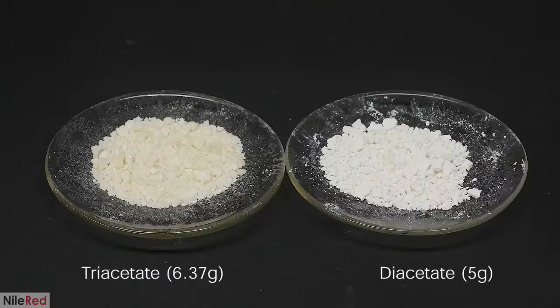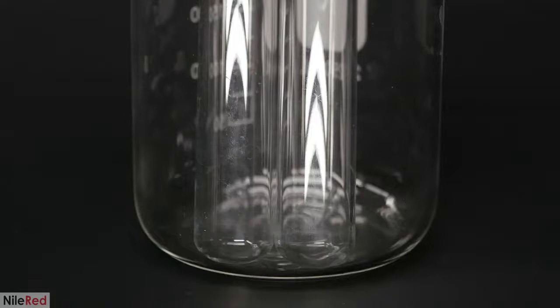When they're both dry, I'm left with some nice hard and crunchy powders. The stuff on the left is the triacetate, and for some reason, it's slightly yellow. I think that it might be like this because maybe I didn't fully wash out all the acid, but I'm not exactly sure. In any case, I'm going to move on and do a quick test on both of them to see if I did in fact make the two forms of cellulose acetate.